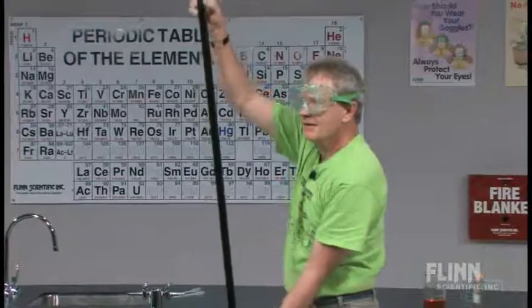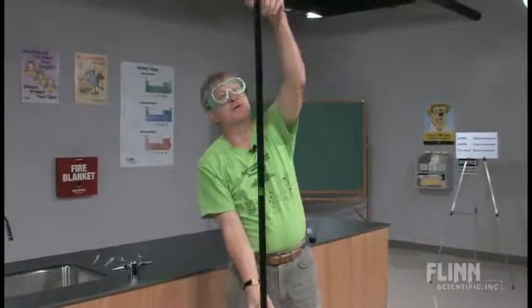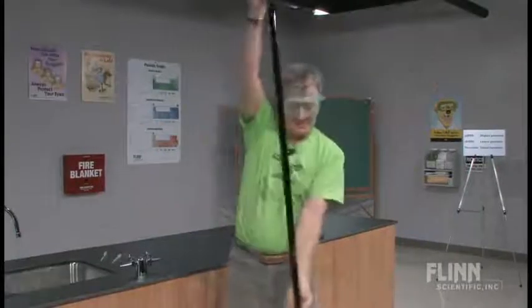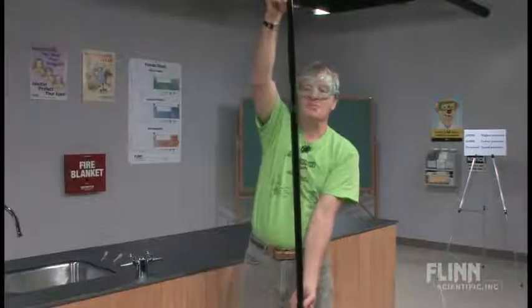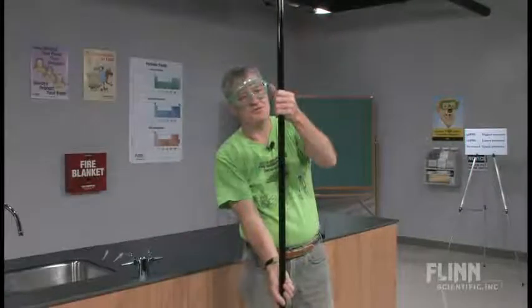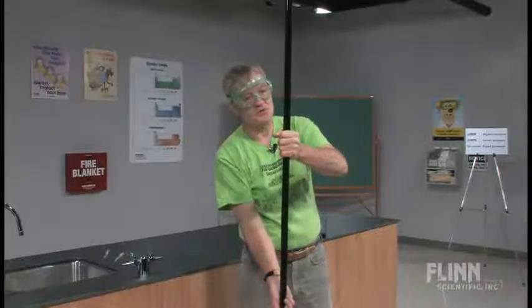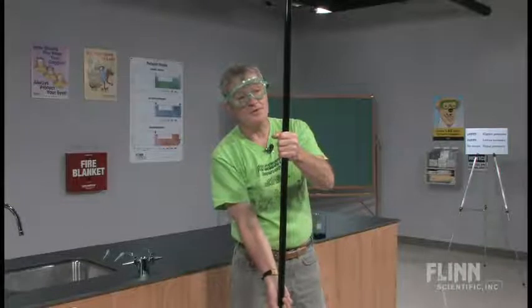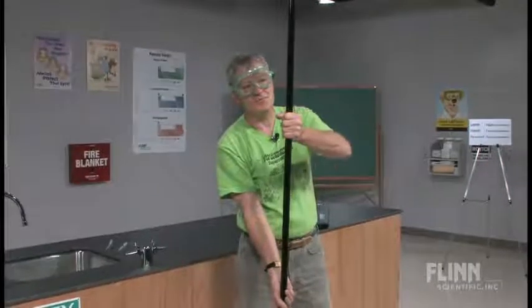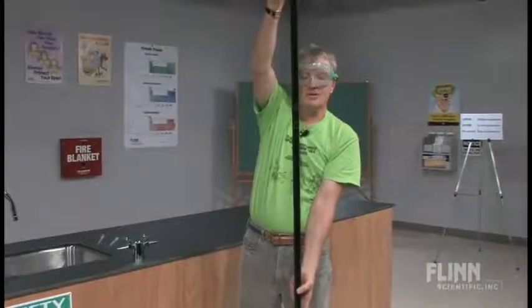There's something else you've noticed here, I hope — what color is it? It's green now. Yellow and blue make green — what did I just learn about these two liquids? I just learned that they mix together because the colors have mixed and given me a greenish color. Back and forth. A student volunteer for this — if you hold this tube especially near the middle it's pretty warm; there's actually some heat being generated. I could talk about heat of solution — it's gained some energy as it mixed — but I'm still a little confused by the bubble and where it came from.